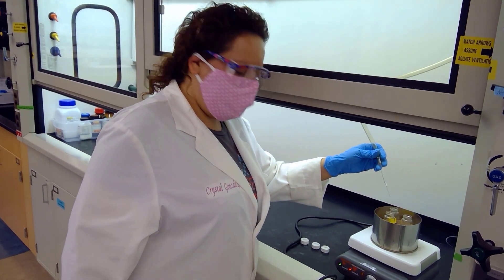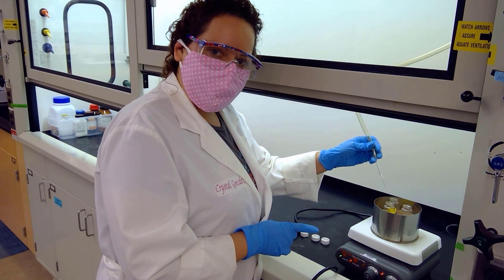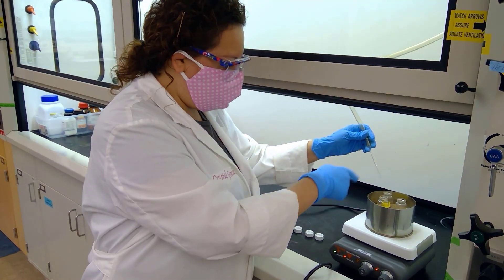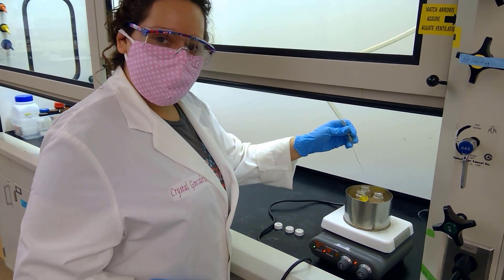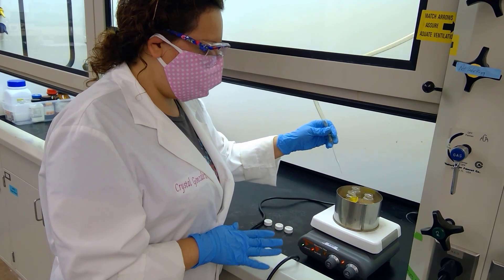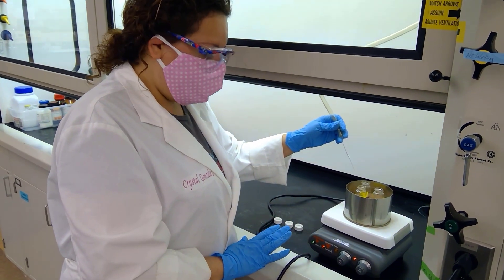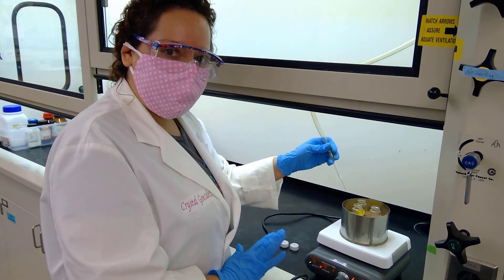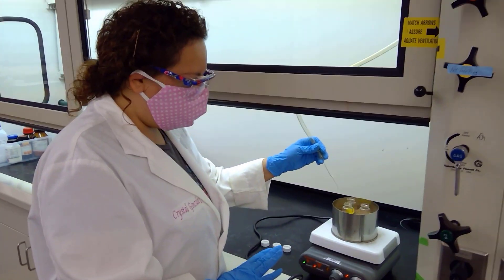Students, we are dealing with the evaporating of the solvents here. I have all of my samples here in the sand bath, and we're boiling away the liquid. This time we aren't going to use boiling chips, though, because our goal here is to obtain only the solids, so we're going to avoid boiling chips.